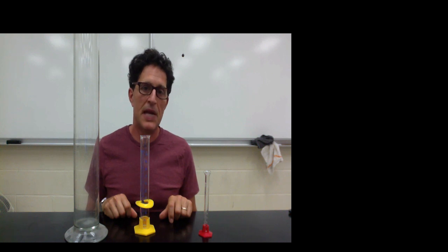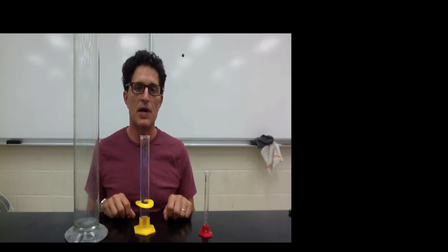Hello, this is Mr. Greisman and in this vodcast I'm going to teach you how to properly measure volumes in a graduated cylinder.